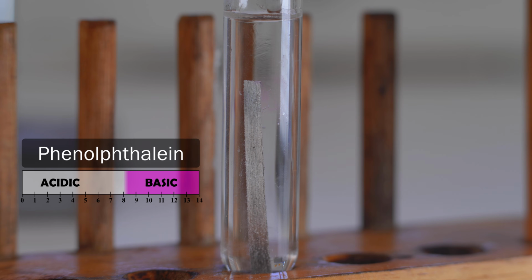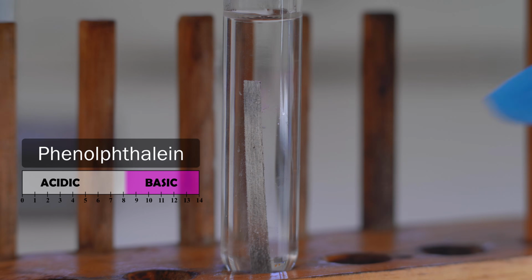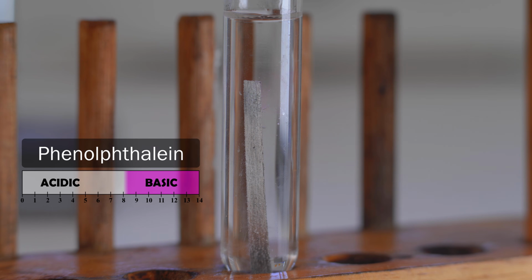Okay, so we haven't seen any chemical change there. It should go pink because we should be making an alkaline solution. What's probably happening here is that our reaction is just going so slowly that we haven't had time to develop enough OH minus ions to get the pH of the whole solution to increase to 8.3.